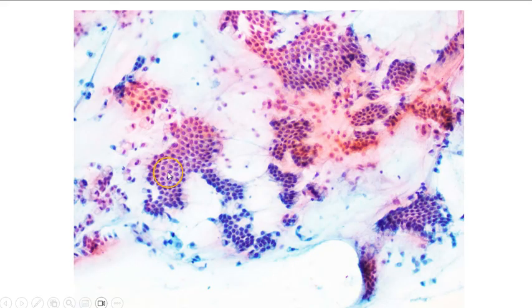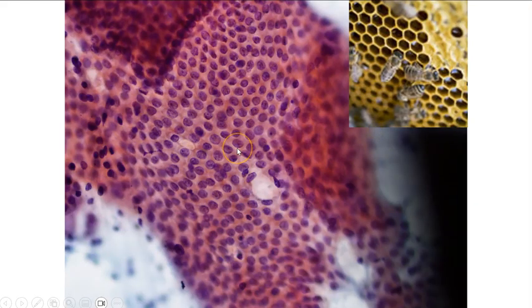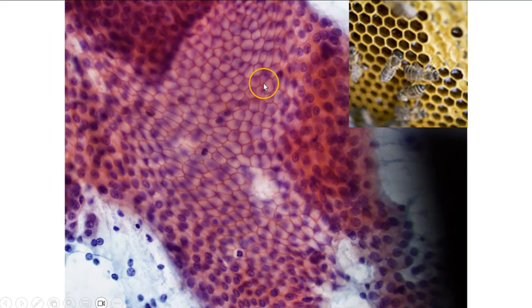Again, we can see some honeycomb sheets of gastric foveolar epithelium, and when the cells are oriented nicely, we can actually appreciate the columnar shape of the cells, and we can see that there is a lot of pale mucin in the cytoplasm. Here also we can see some thin mucin in the background. And this is what they look like on the air-dried smears. Again, we have honeycomb sheets of columnar cells with some thin mucoid material in the background. And when we focus up and down, we are actually able to see the mucus cap, and we can see the cytoplasmic borders very clearly, forming this regimented honeycomb arrangement. So this is what we will typically see in benign gastric foveolar epithelium.